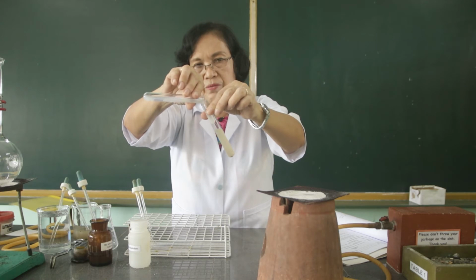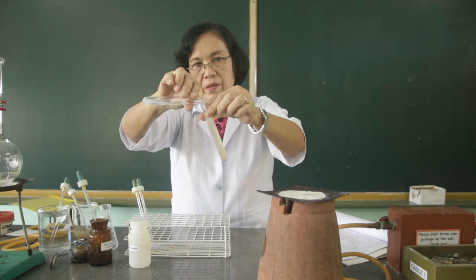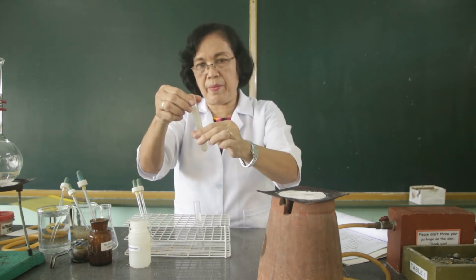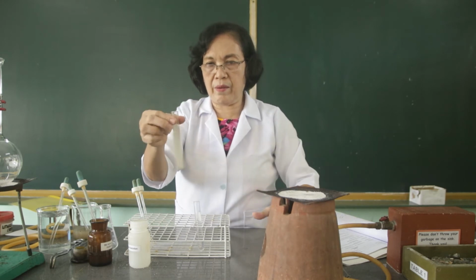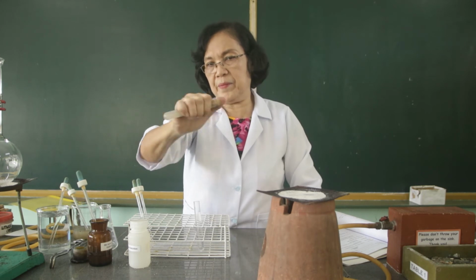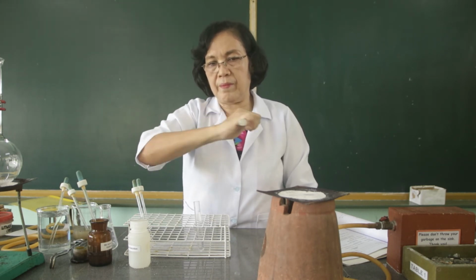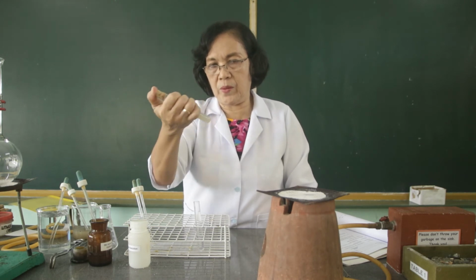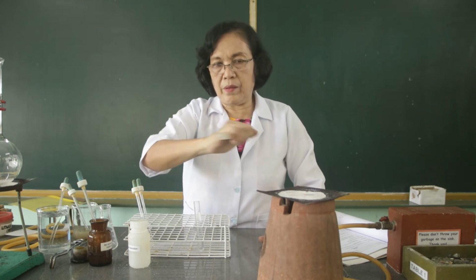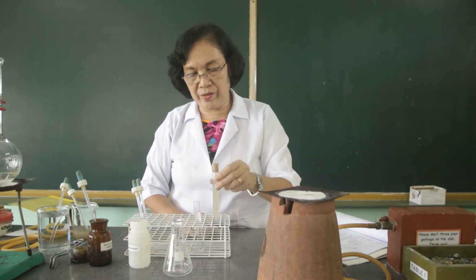I want you to observe. Let's mix it thoroughly. After mixing it thoroughly, we are going to filter this.